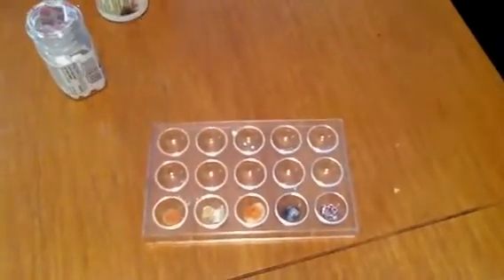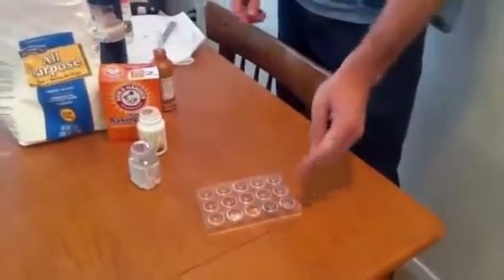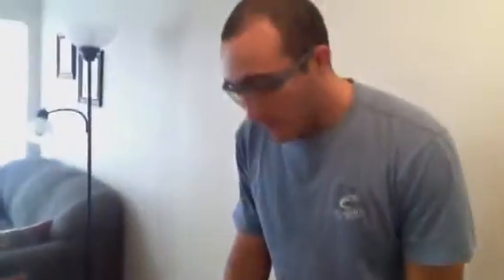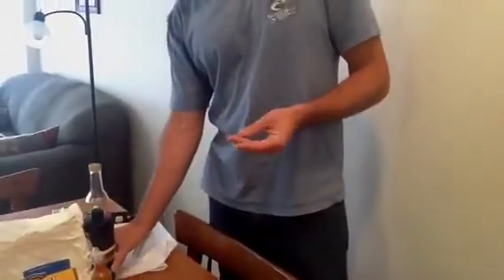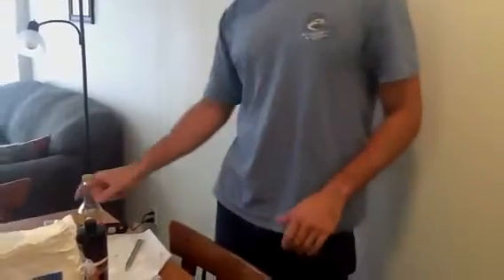But the point of this lab, ladies and gentlemen, is we are going to do our control reactions. We're going to use these 4 white powders, which look exactly the same. And then we're going to test them with iron nitrate, which is a dangerous chemical, so I should be wearing gloves right now. Hopefully the person handling it will be wearing gloves. Lugol's iodine solution. You all may have used iodine in a biology class in the past. You do not want to get this on you. It will stick to you and it will stay there for weeks. And vinegar. Those are the 3 liquids that we are going to use.